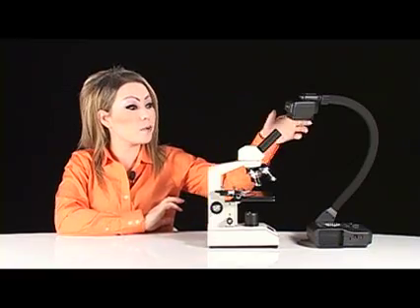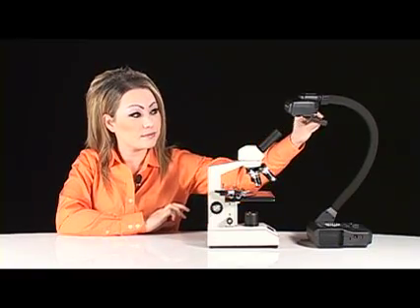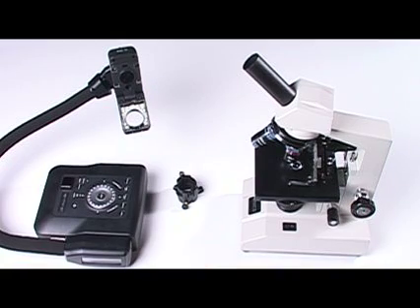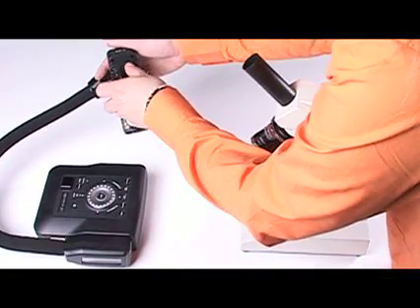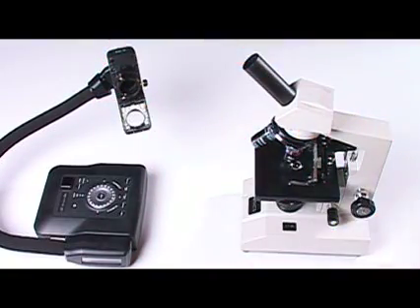First, open the LED flip light. Then take the appropriate sized adapter and attach it to the lens located at the bottom of the camera head. Make sure to latch the top part first and allow the lower magnetic portion to snap into place.